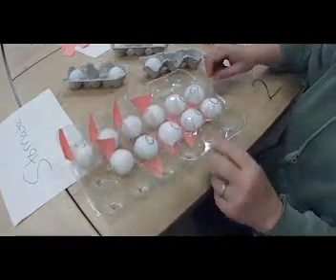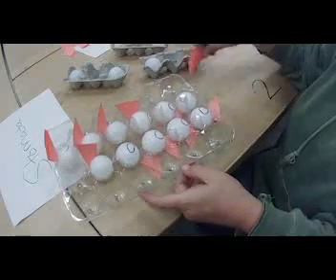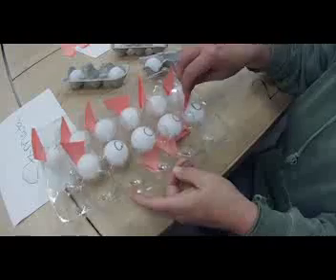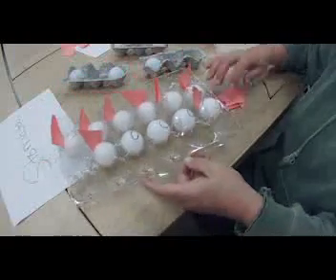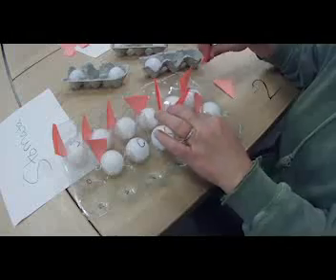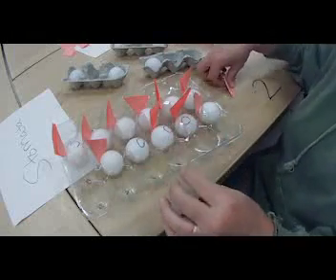And actually, I think it's easier if we all see all of these sitting up. So I'm going to pull these out from underneath my other chemical energy just so that we can see them a little easier on the camera.